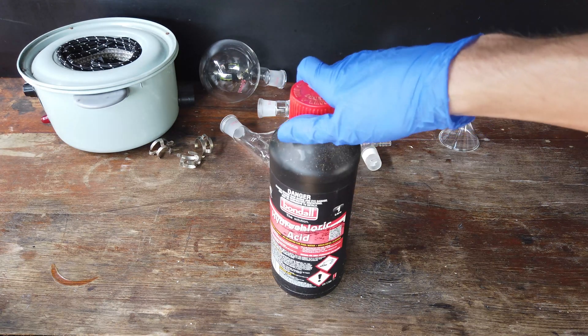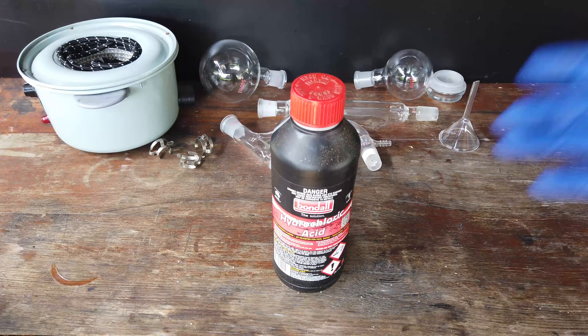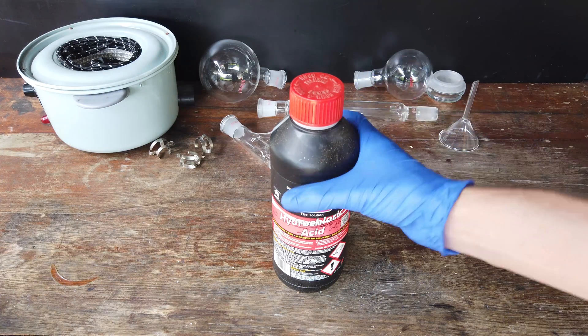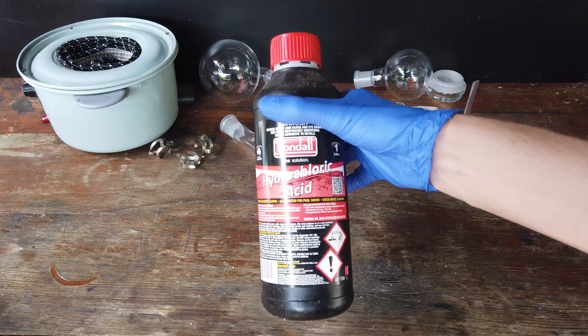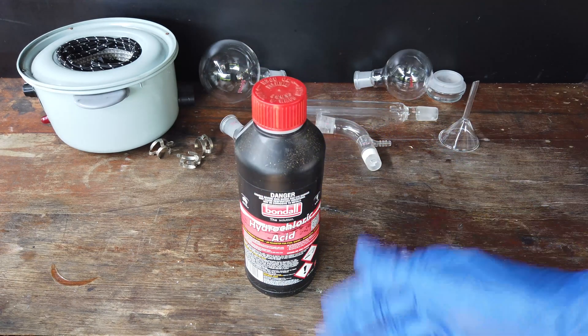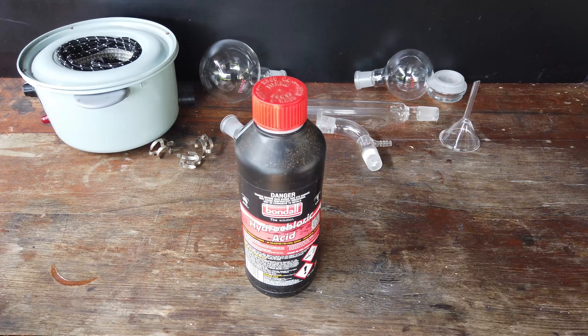Okay, hydrochloric acid, as we have here, and as you probably know, is a very, very useful chemical. It is by far the cheapest mineral acid I can get hold of. I get it from my local hardware store. I think it says here as 32% hydrochloric acid as a solution in water, and it's always handy to have around.